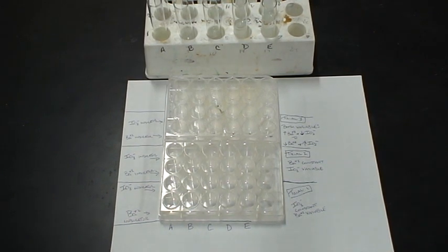Welcome back. Now that we've allowed the test tubes to rest for at least 10 minutes for all the precipitate to fall to the bottom, the question is what do we have left over that's not reacted for reagents? We call that liquid on the top that has the remaining reactant the supernatant.